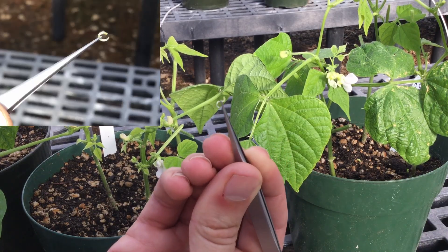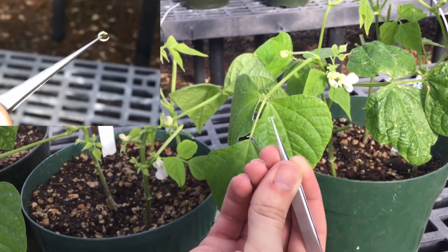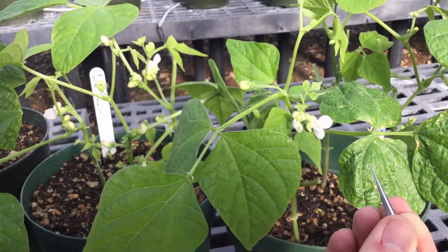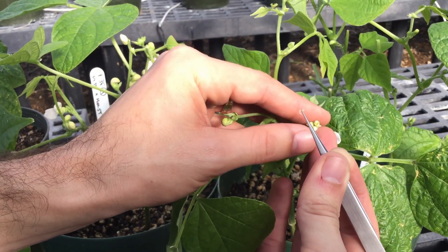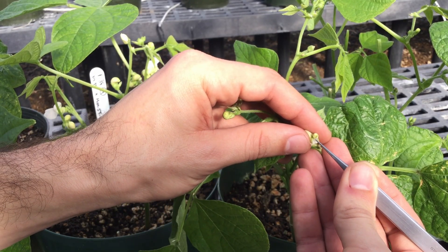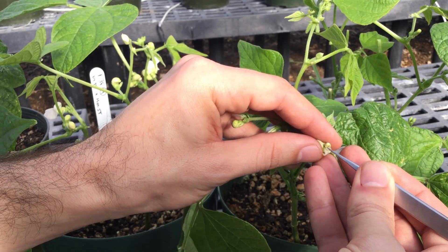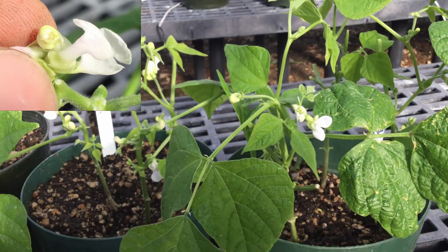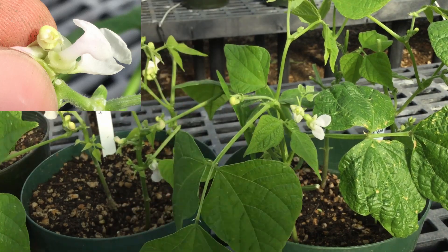If we look super closely, you'll actually see there's just a tiny bit of pollen on that. So we can go back to our mother plant again — this one, if you look super closely, should not have any pollen on it at all. If the petals had already opened, you might see some pollen. What we're going to do is rub the two together and get the pollen from the father plant onto the other stigma. Then at the very end, once we've done that, we want to hook the two together — one stigma linked up with the other.